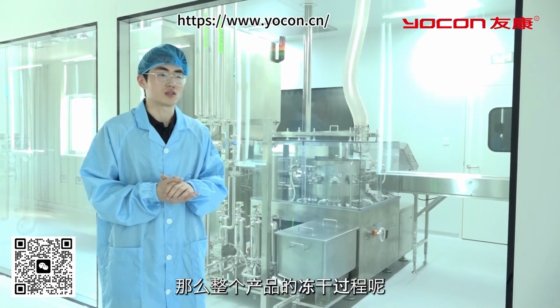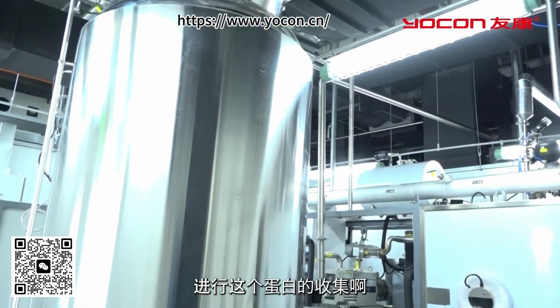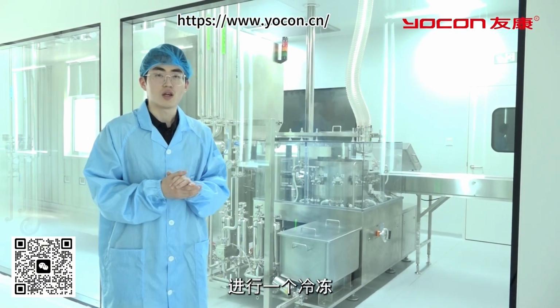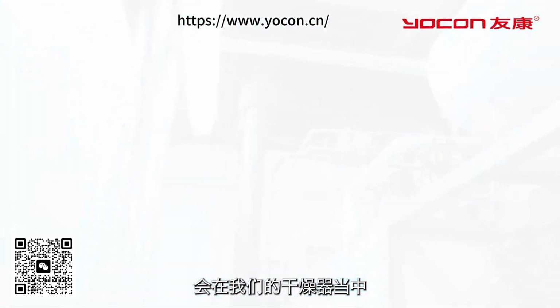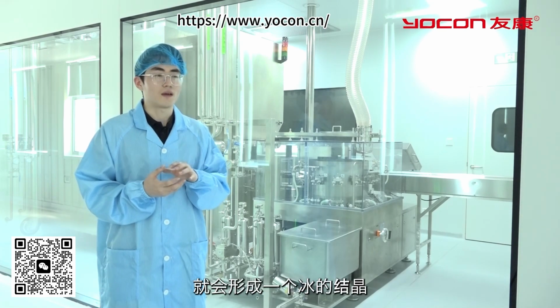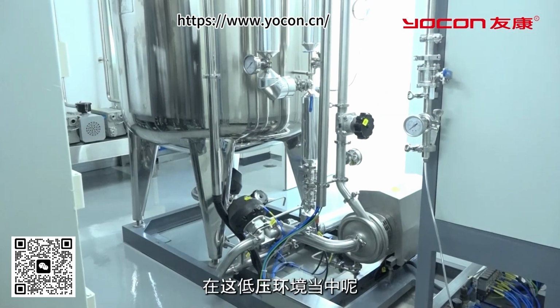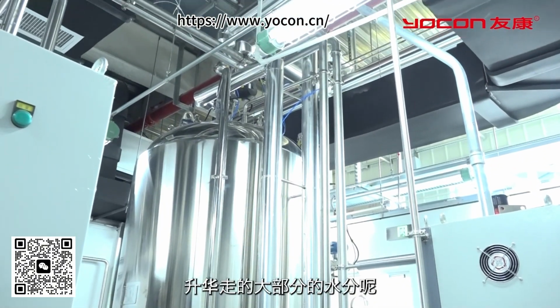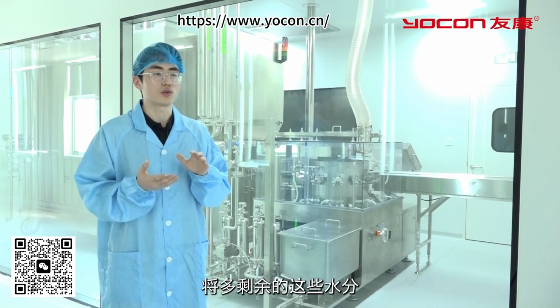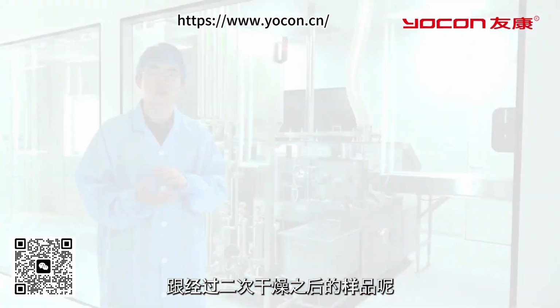Firstly, there's sample pretreatment, such as liquid preparation, protein collection, and so on. The second part involves placing the pre-collected and processed products into a dryer for freezing, rapidly reducing the temperature to between -40 degrees Celsius and -80 degrees Celsius, so that the water carried in the product forms ice crystals. Next comes primary drying, where a low-pressure environment promotes the sublimation of ice, removing most of the ice from the sample. Then comes secondary drying, where the sample is slightly heated in a low-pressure environment to remove residual moisture. Finally, the product is packaged and stored in a low-temperature, dry environment.